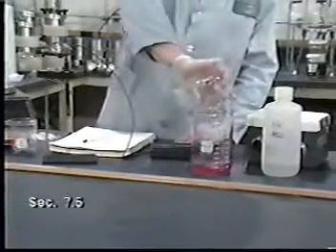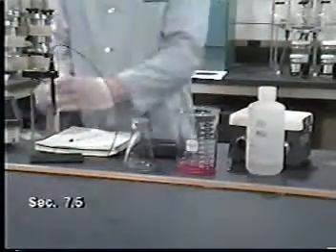The samples used up to now are discarded. They are not used for the actual extractions.